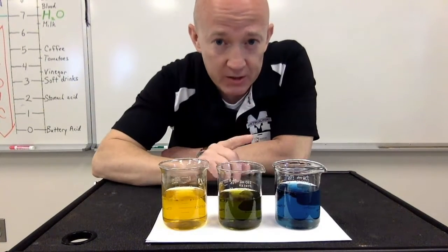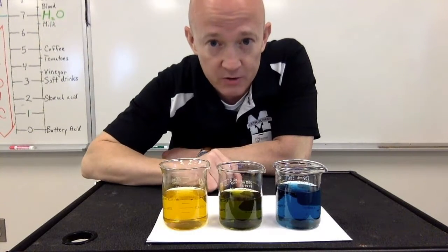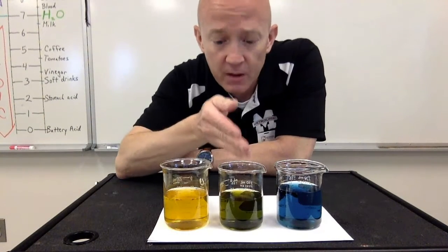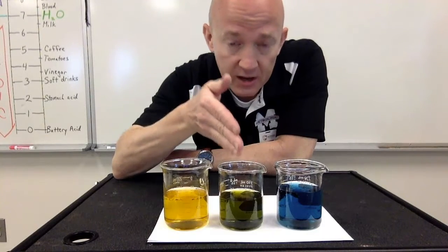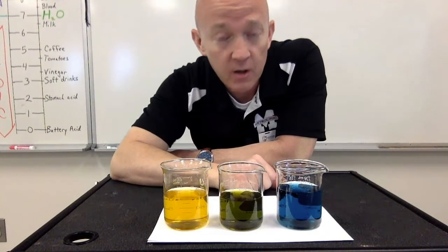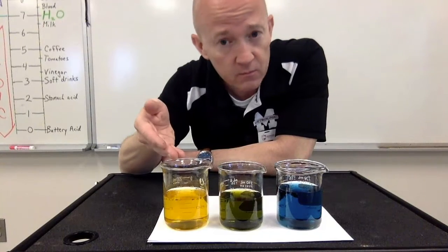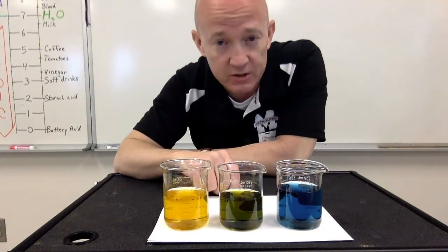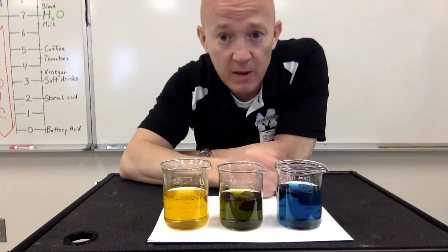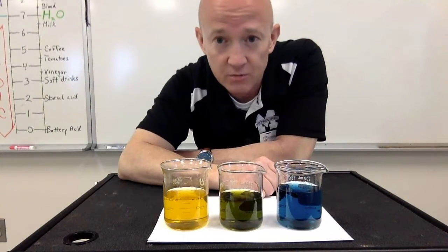Now what I haven't told you is that there are 3 different types of salt in each of these beakers. This one right here in the middle is our classic sodium chloride. We see that it produces a neutral solution. But another type of salt that we call ammonium chloride produces an acidic solution. And the one that we used in the last video with our titration is called sodium acetate. And as you can see, it produces a basic solution.